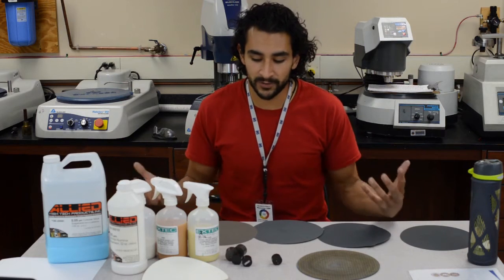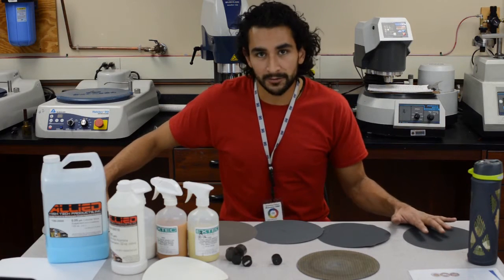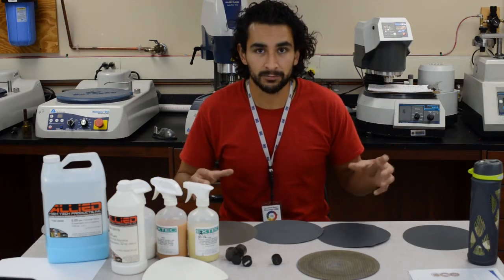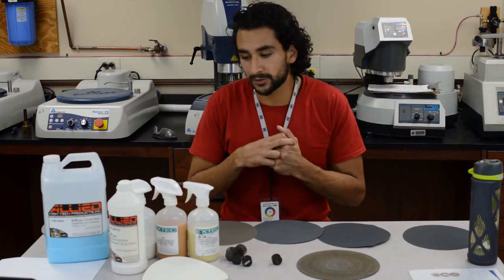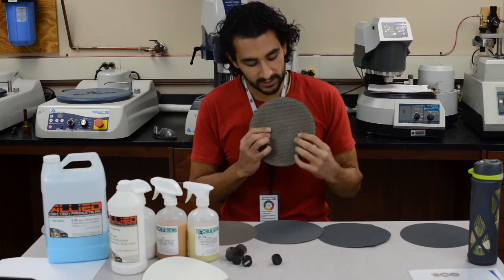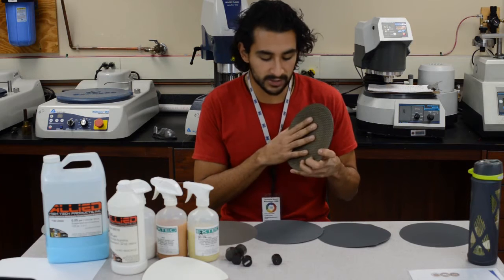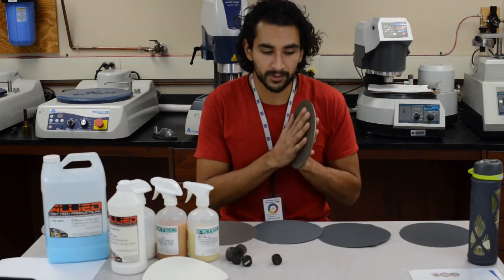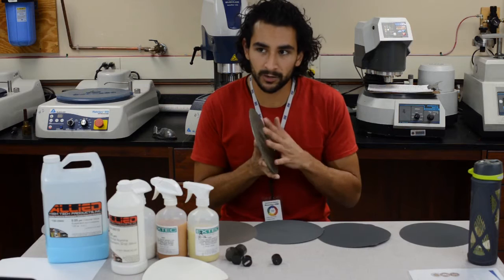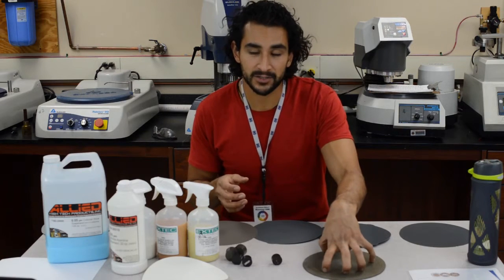These are all silicon carbide. Some people like to go through silicon carbide all the way and then throw it in the vibrational polisher to get really nice cross-sections. I like to do some other steps. There are these diamond impregnated pads — these are reusable as opposed to the silicon carbide. You can use them several times and they help to get rid of some silicon carbide particles. If you do silicon carbide all the way to the end, you might end up with some silicon carbide particles embedded in your sample, so these diamond impregnated pads are really useful.